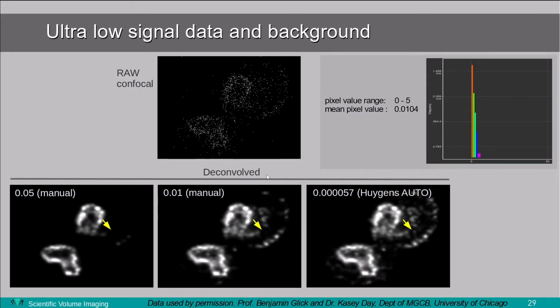So let's now look at an example again. This is a raw confocal dataset, again from a Leica confocal, an SP8. And here we used different background values, 0.05, 0.01, and we used the Huygens automated mode. And you see that it comes up with a value that I would at least not guess. And you see the effect of that. The automated mode still shows objects that disappear if we use a too high background setting. So of course you can set it manually and lower it manually, but Huygens gives already a very good suggestion in what the background value should be.